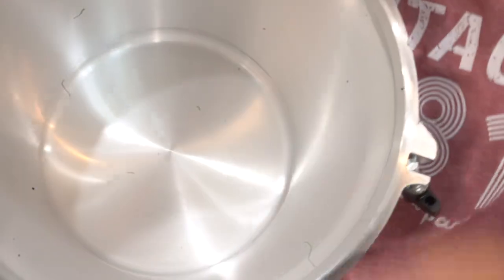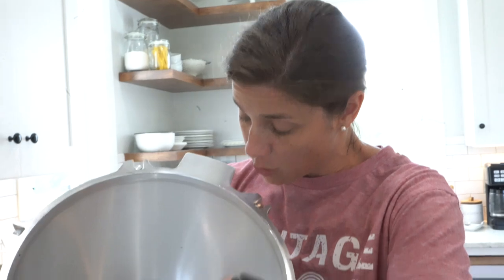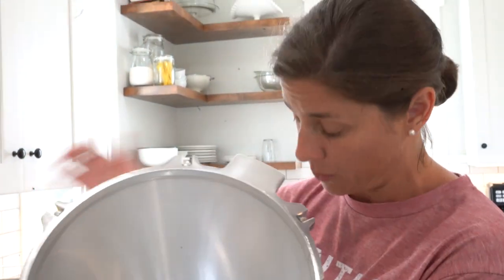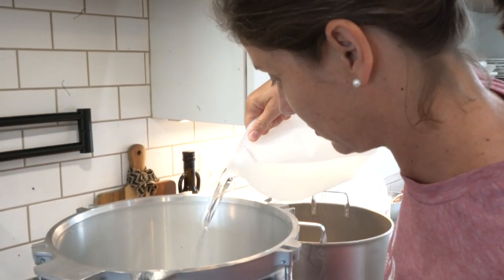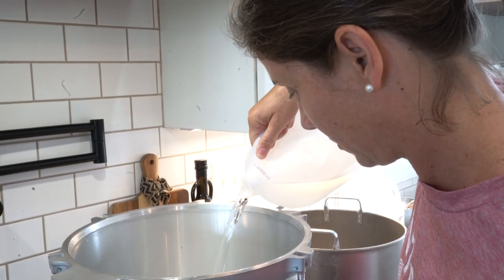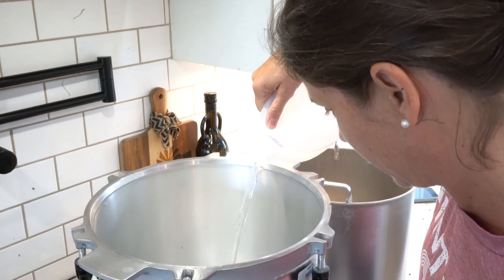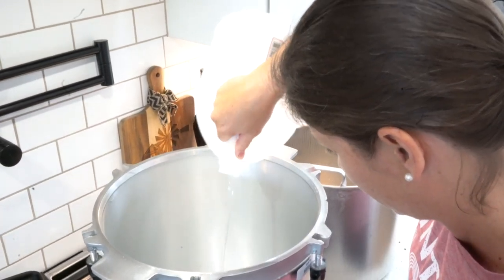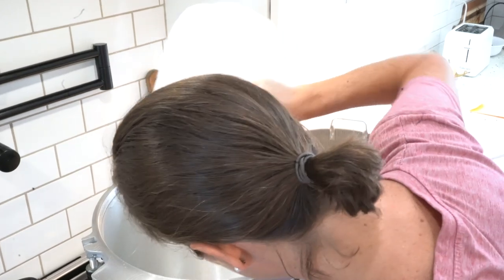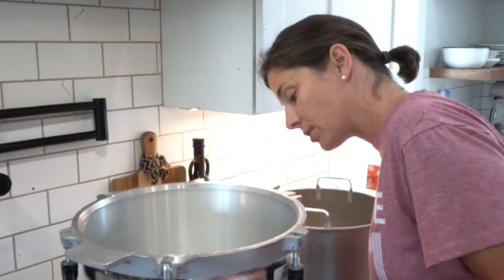There's a water line that is machine-etched into the pot that you can see and feel — that is where you fill the distilled water up to in the bottom. About half a jug that I already had opened looks like it's right to the watermark.